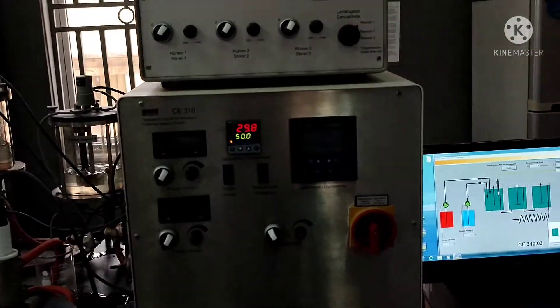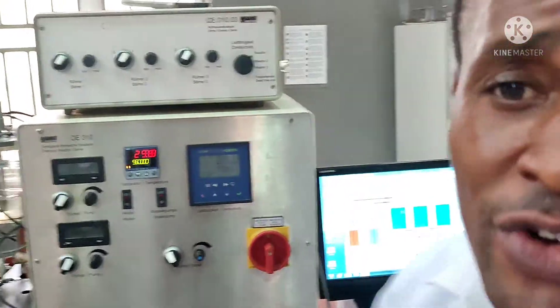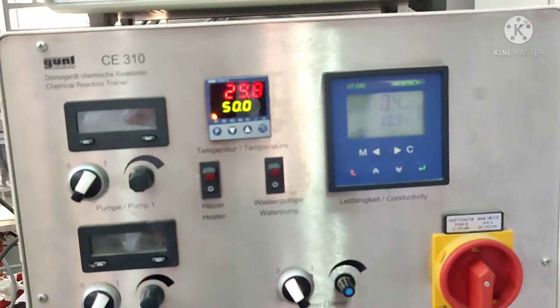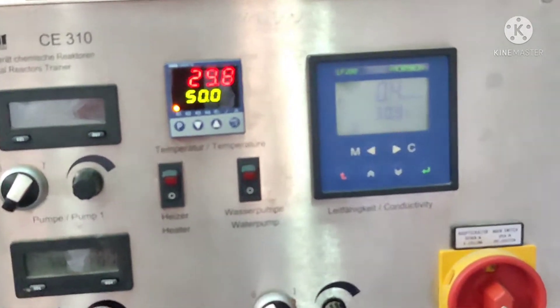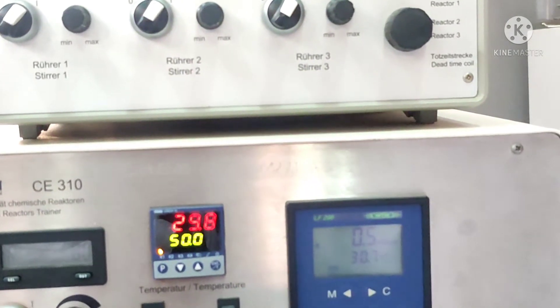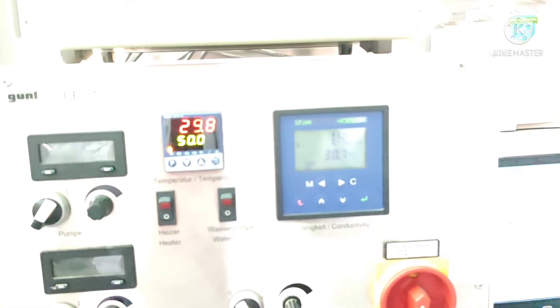Now let's see how to take the readings for reactor 1, reactor 2, and reactor 3. The extent of reaction is related to conductivity. For reactor 1, we have 0.4 mS/cm at 30.9 degrees centigrade. Then you switch to reactor 2 and take your readings after 5 seconds for it to stabilize — we have 1.4 mS/cm at 30.7 degrees. Then we move to reactor 3.